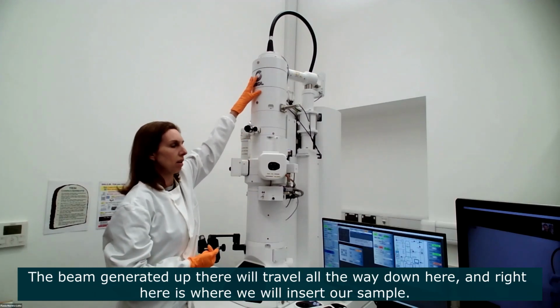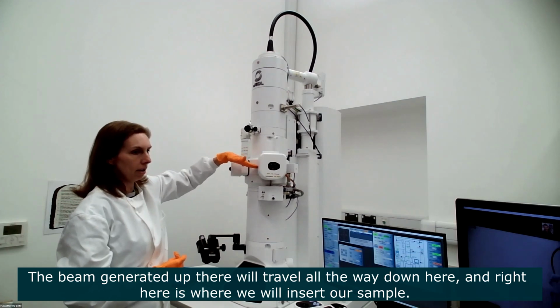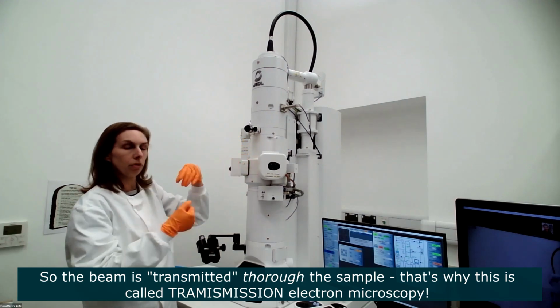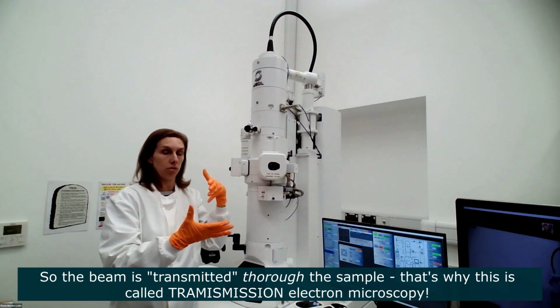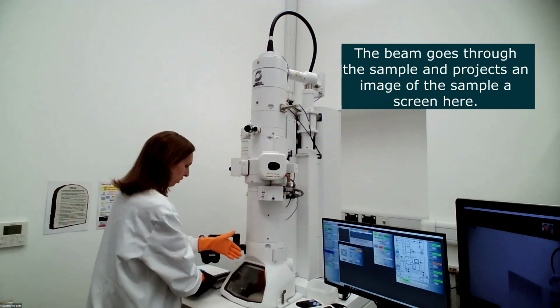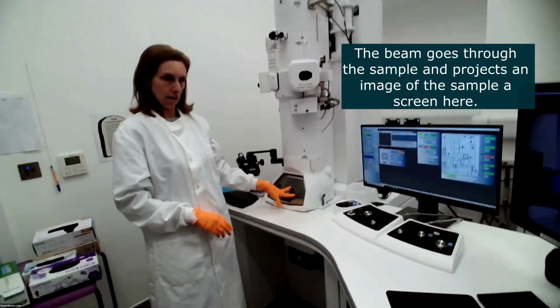So the beam generated up there is going to travel all the way down here, and right here in the middle, we are going to insert our sample. The beam will go through the sample. So this is called transmission electron microscopy, because the beam is transmitted through the sample. The beam will go through that section of sample here, and then it will project an image of the sample on a screen here.